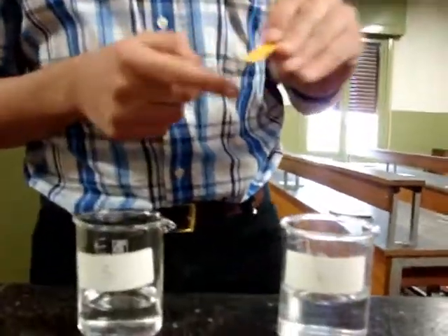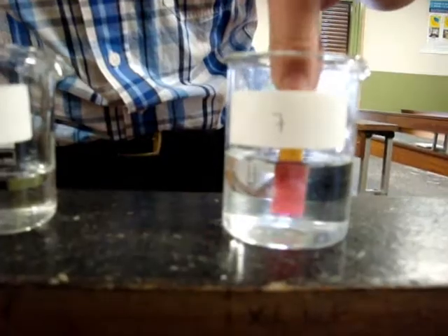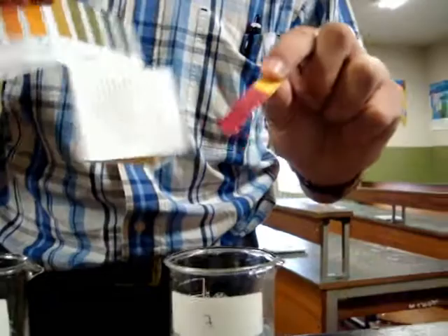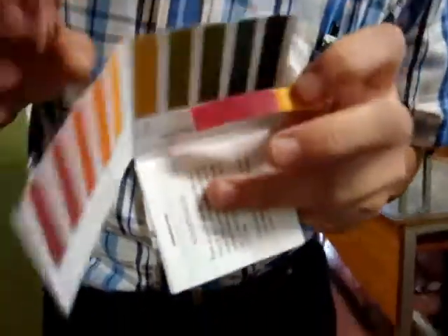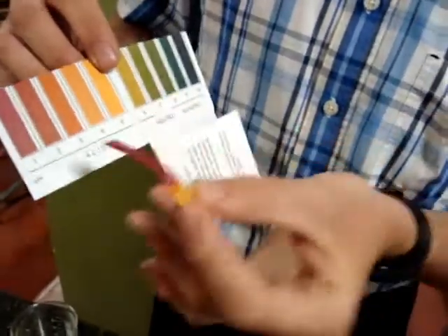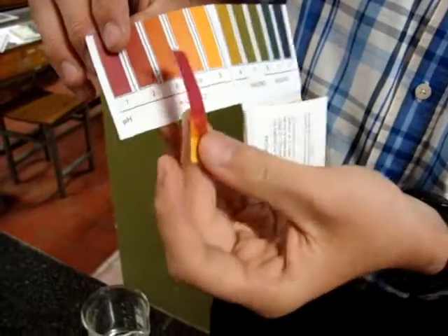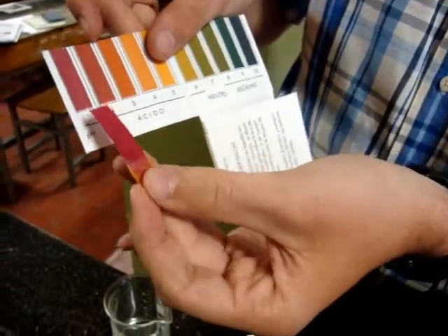Now we are going to put it here. And it turns red. If we look at the colors of the acid and basic substance, we can see that a lower pH of 1 — it is an acid substance.